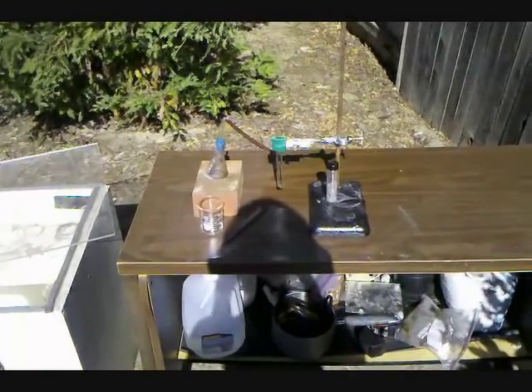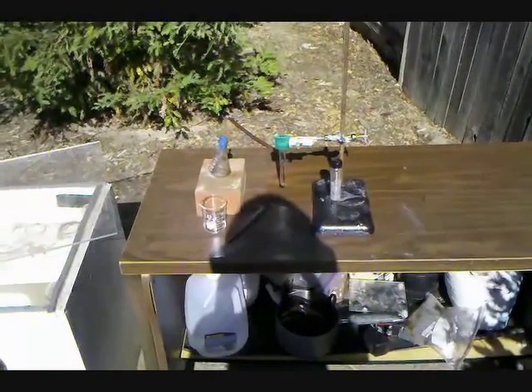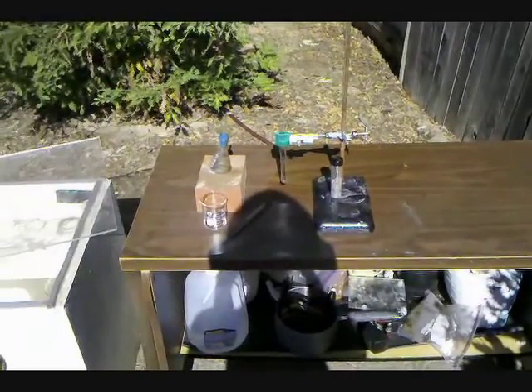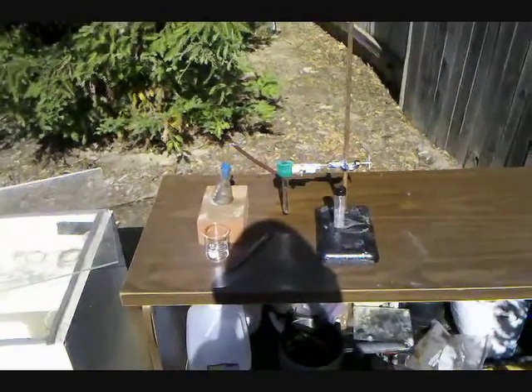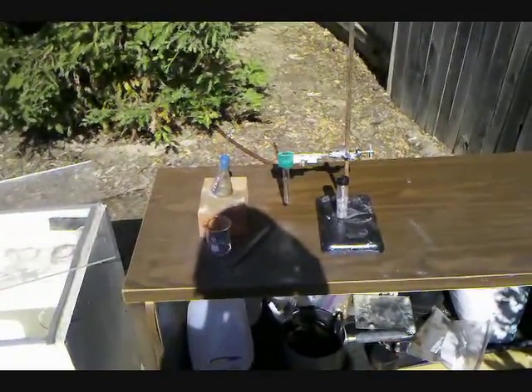Hey everyone, time for some organic chemistry. In this video, I'm going to be showing a dehydrogenation reaction, and what I'm going to be dehydrogenating is acetylene.